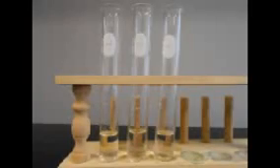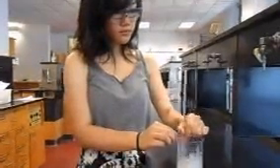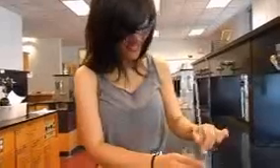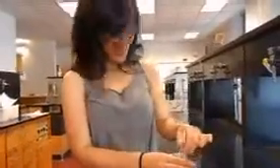Now pour an inch of each antifreeze solution into each of the 3 test tubes, and then create an ice bath using the 6 ice cubes and the 20 grams of salt. This will be used to check the freezing point of each solution. You can stir the ice bath to mix up the ice and the salt to make it colder. Let each test tube sit inside the ice bath. When the solution starts freezing, check the temperature. That will be your freezing point.